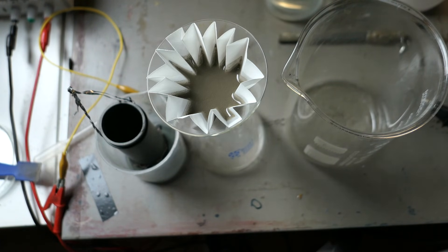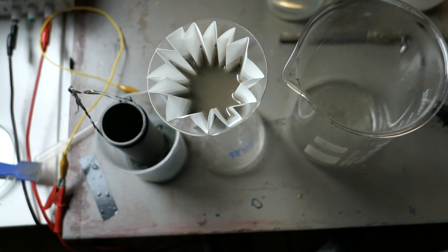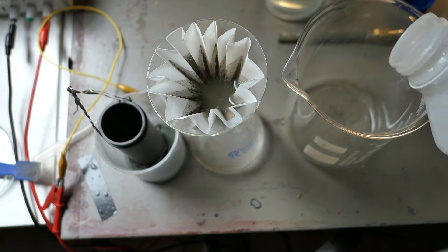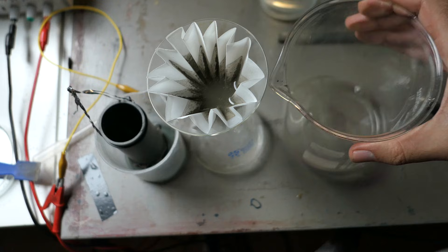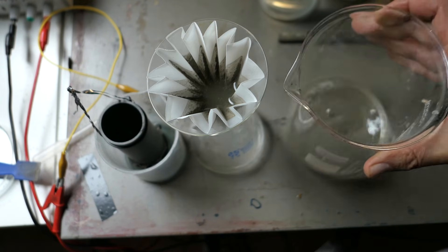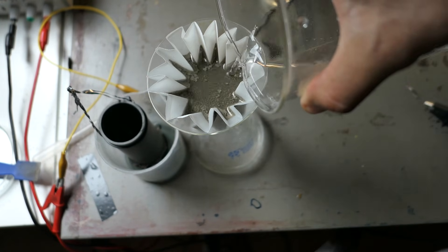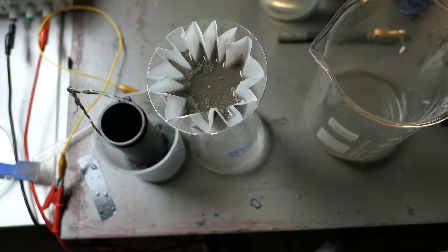And now, let's take a look at the final results. After several hours of electrolysis, filtering and drying, here's the pure silver I was able to obtain.